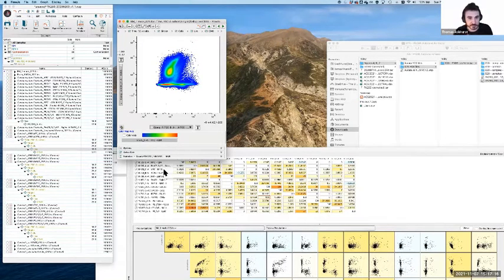When we're looking at spillover pairs, something spilling into another detector, we're looking for, as it's getting brighter, it is by definition getting brighter in a different detector, as opposed to it being higher in one detector and then some of it expressing higher levels of another marker. We really want to see that long string of cells. It's mathematical, right? As it gets higher in one detector, it is by definition increasing in another detector. That's the key thing that tells us it's something mathematical as opposed to biological.